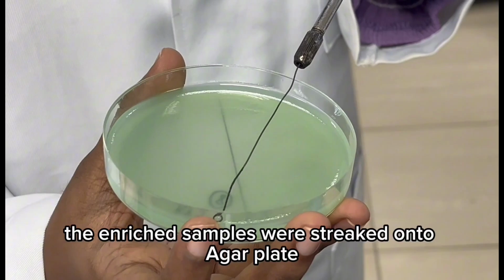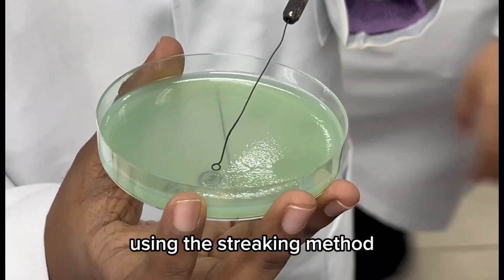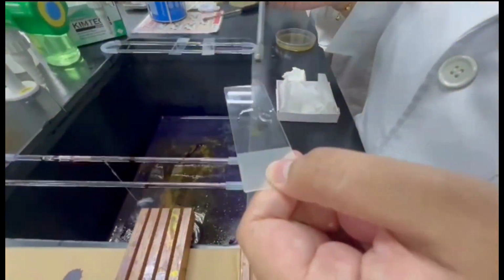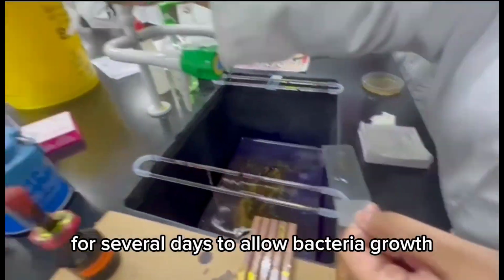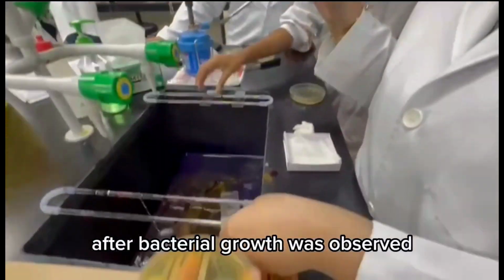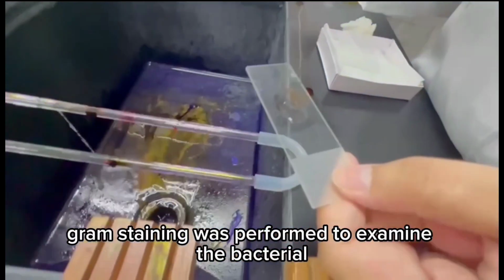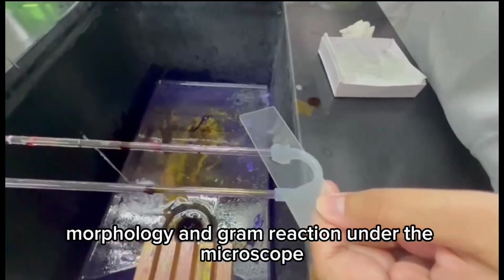Next, the enriched samples were streaked onto agar plates using the streaking method to isolate bacterial colonies. The plates were then incubated for several days to allow bacterial growth. After bacterial growth was observed, gram staining was performed to examine the bacterial morphology and gram reaction under the microscope.